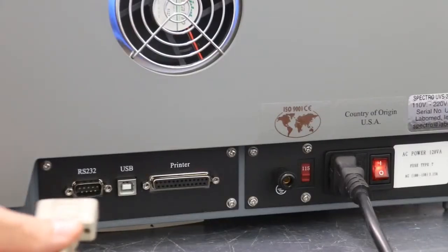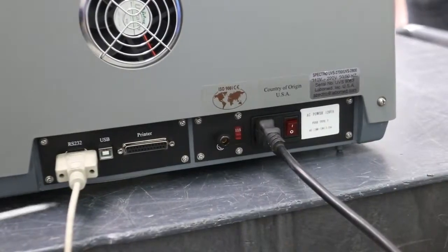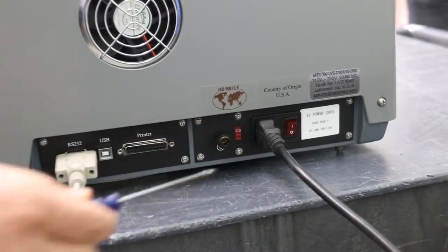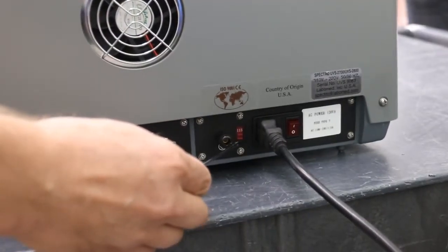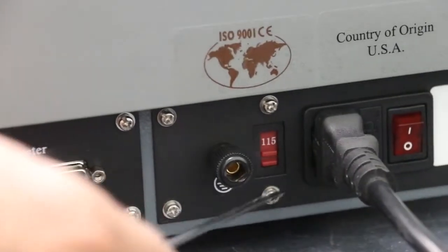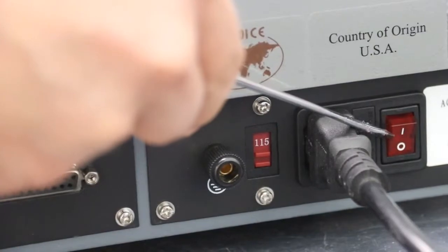Connect the RS-232 cable. Make sure the unit is adjusted to the correct voltage. Since we're in the United States, it's 115. This is the on switch for the unit.